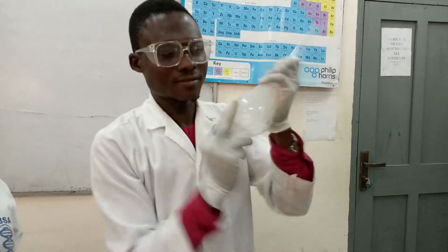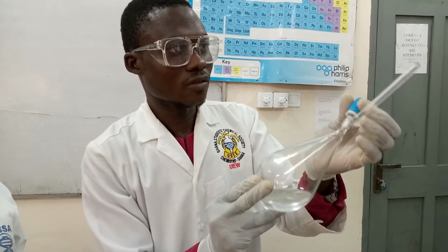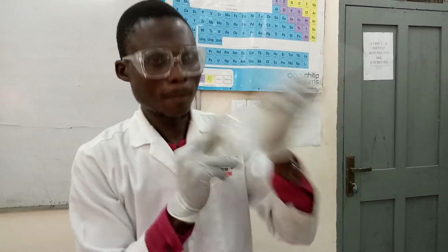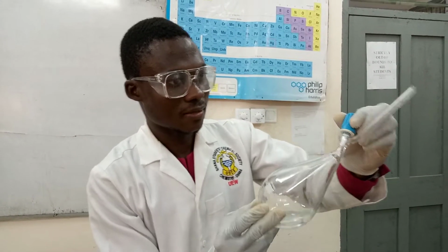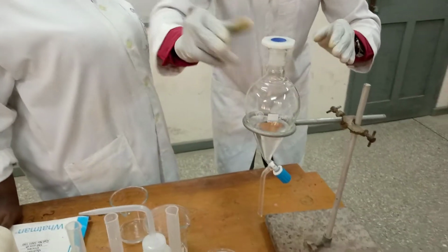Then you do it again. Then you release pressure. Now I'll do my last one. Release pressure. Then you tighten it back. Then you put it back and make sure the 2 layers separate.